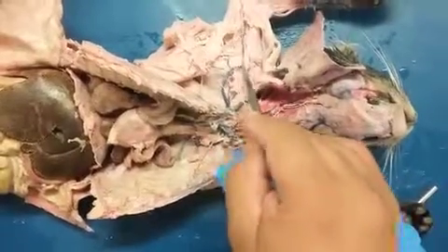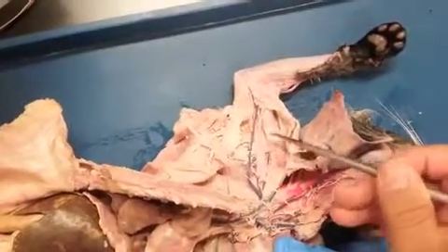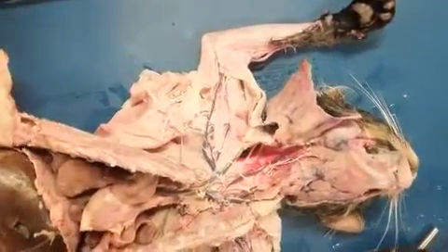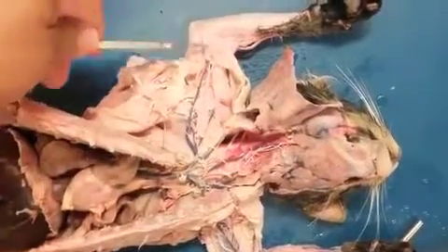And then as it makes its way into the brachium, this is where you have your brachial artery. Can you see, is there a clear point at which it becomes the brachial artery instead of axillary? The clearest point is once you know that you're pretty much in this area, because you're in the brachium. Yeah, it's literally named by the region that it's passing through. And so that's what you would go by.